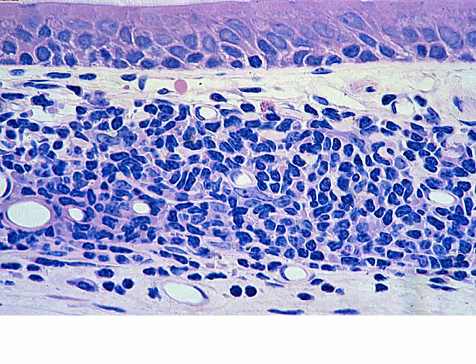Now, in this particular field, we're still in our respiratory epithelium, pseudostratified columnar epithelium, ciliated. And in this connective tissue region, there are a ton of lymphocytes and plasma cells. We are going to discuss these in our lecture podcast. This is going to be transient lymphatic accumulations. They're called mucosa-associated lymphatic tissue, or MALT. And we're going to see these in the respiratory tract.